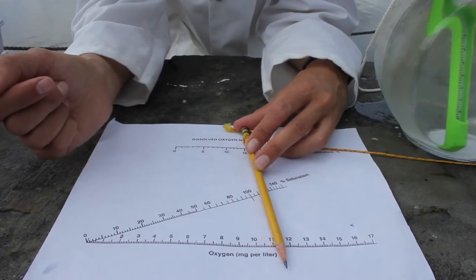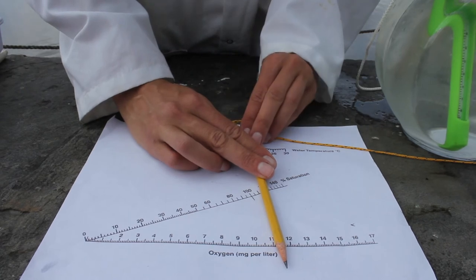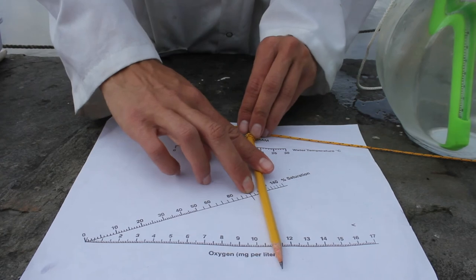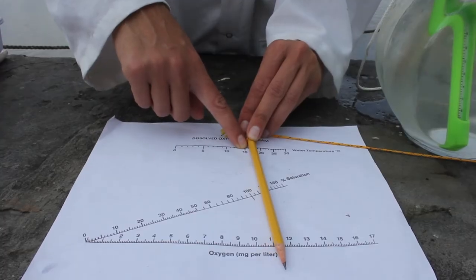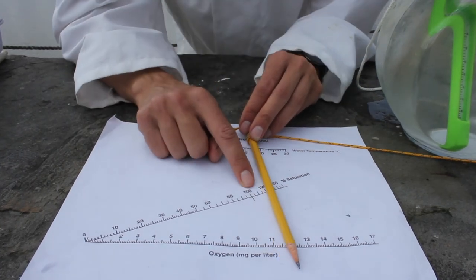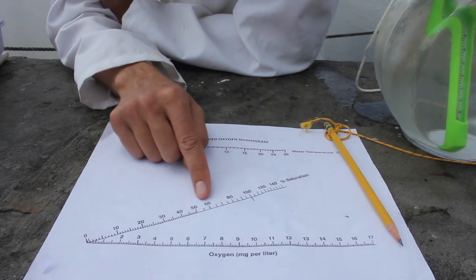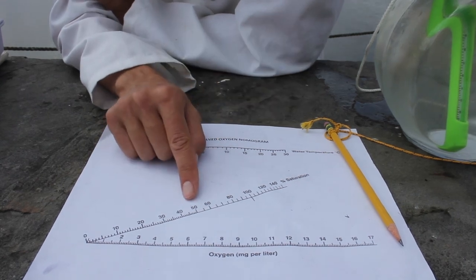This is a useful chart that helps us see the relationship between dissolved oxygen and temperature. So what we can do is take our dissolved oxygen number of 11 parts per million, or milligrams per liter — it's the same — and line it up with the temperature, which we found to be 16 degrees Celsius. And where those two lines intersect, it shows us the percent saturation of the water. A hundred percent saturation is good — that means that this water is holding as much dissolved oxygen as it possibly can. Below that means you might have some kind of issue, like a pollution issue, an algal bloom, something that's depressing the amount of oxygen that the water could potentially hold.